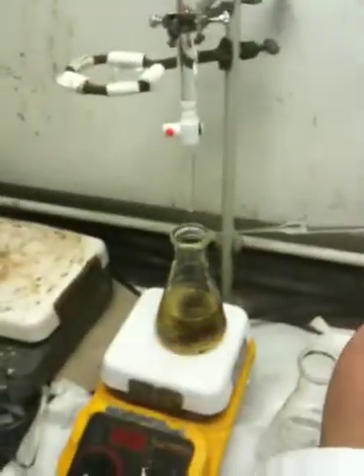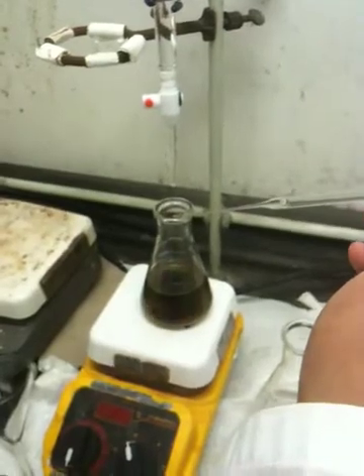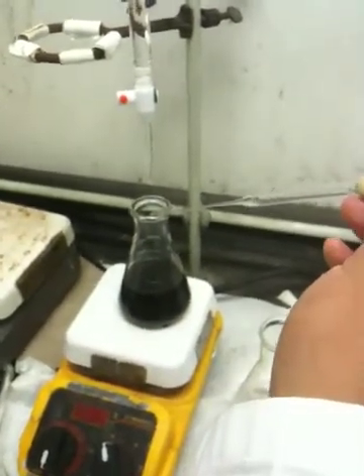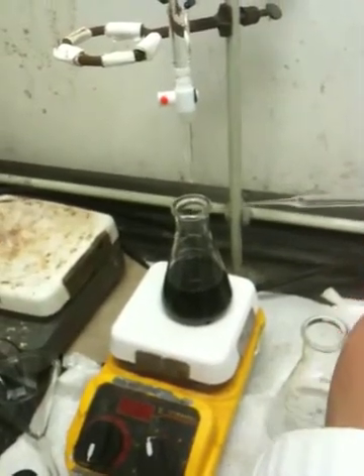So he's now going to add this starch slurry solution prepared by yours truly. He's going to add about 10 drops. Look at the magic — it changes, after 10 drops, to a nice dark blue purple color, but it looks really black. Kind of hard to tell, but it's actually dark blue.